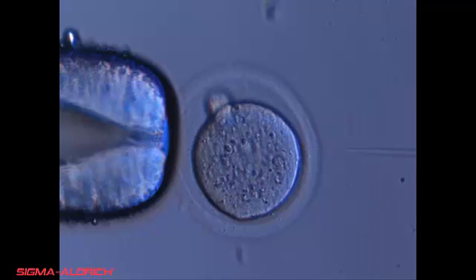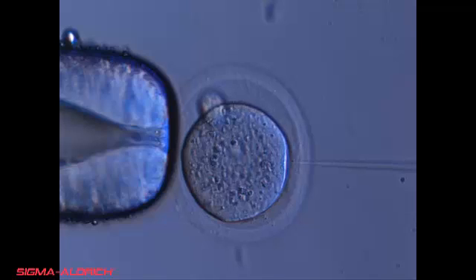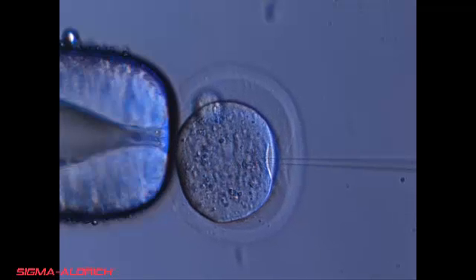Having both the pronucleus and the tip of the needle in focus should assure that both are in the same viewing plane, allowing the needle to directly penetrate the pronuclear membrane. Next, move the injection needle into the embryo, making sure to move in a planar fashion, piercing the zona, the vitelline membrane, and the pronuclear membrane.